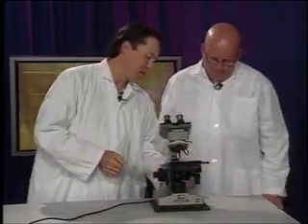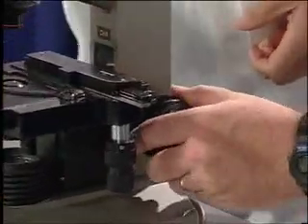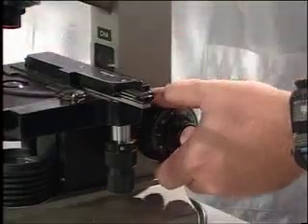Okay. The very big outside one is this one right here. And if you want to give that a spin, let's just get this back. It won't go this way. Oh, it must be at the bottom. Yeah, it's bottomed out.